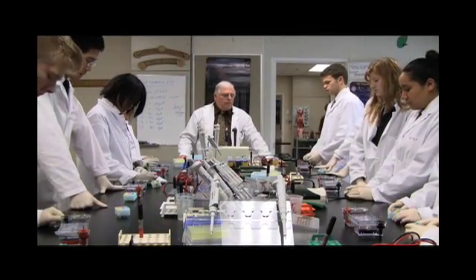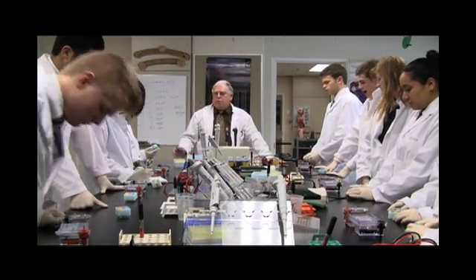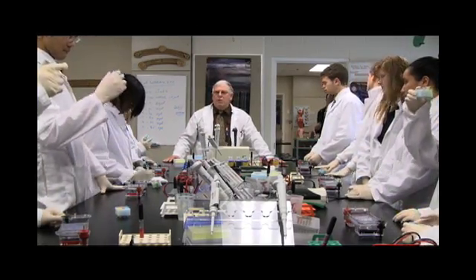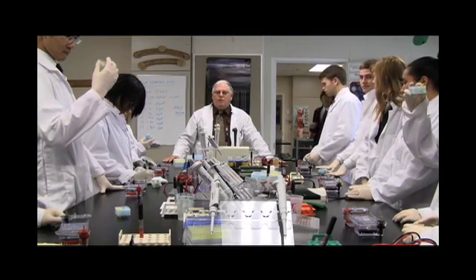If you look at your samples from the fridge, they're clear. You can't load them in the well and see what you're doing, so we have to get them to a point where you can visualize them.